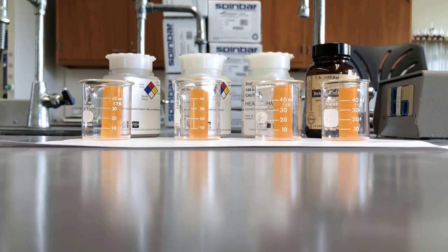So what this next part is, it asks us to measure out one mole of each substance. So we have copper, sodium chloride, sodium bicarbonate, and tin powder going from left to right, just as it's on your worksheet. And so a lot of times people get stuck thinking about, oh gosh, how much is one mole of material?